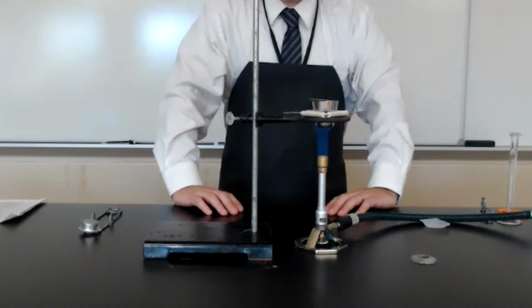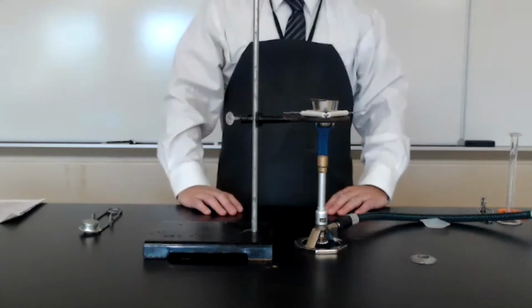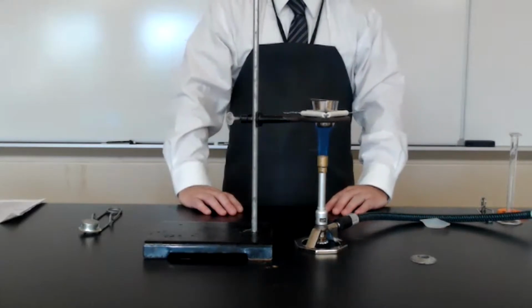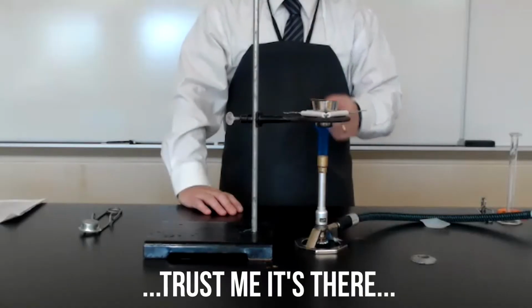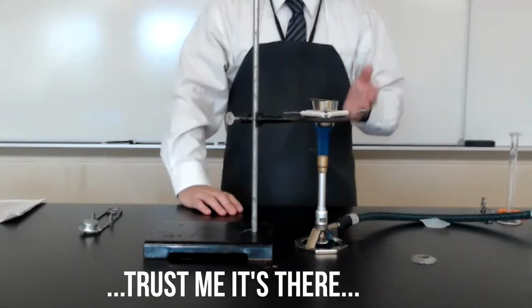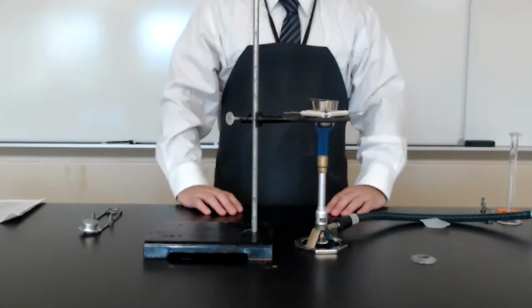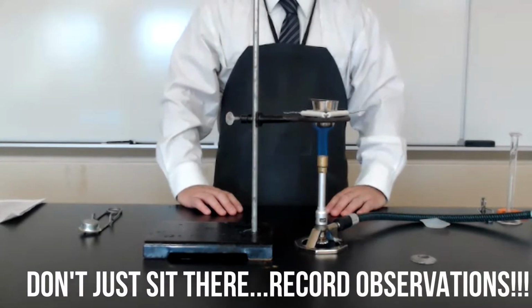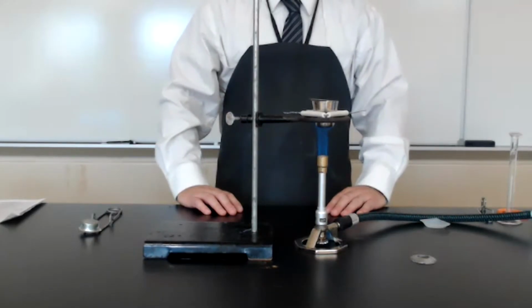Since there's such a small amount of water, you'll quickly hear the water start to boil. Now, and it's probably difficult to see, you can start to see some of the water vapor from the sample evaporating and leaving the crucible. When all of the water vapor has evaporated, turn off the gas jet and allow the crucible to cool before handling.